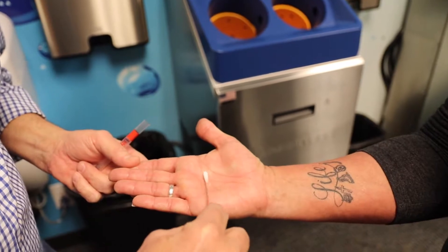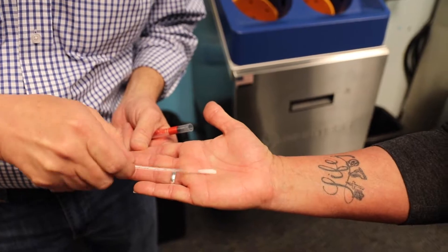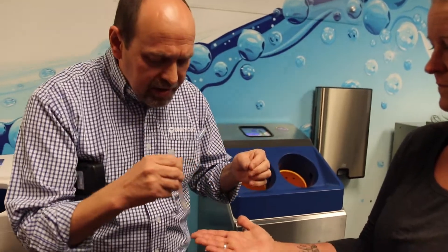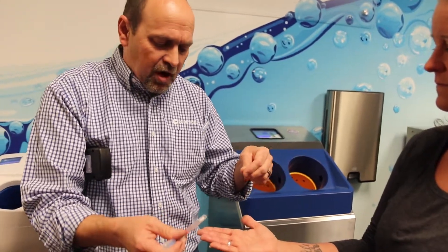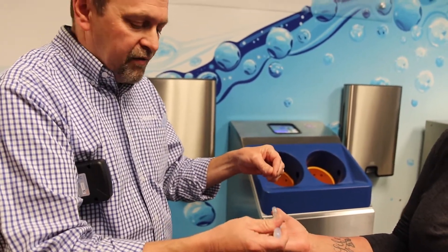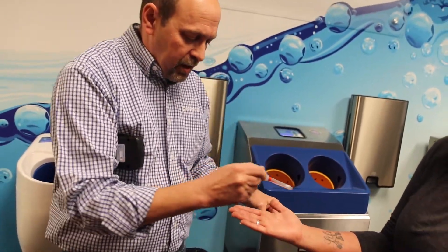I'm going to color that square in, two-by-two, and rotate it 90 degrees, turning the swab the whole time, then draw an X. The reason I use just a two-by-two square within the palm is for consistent methodology. I'm not swabbing the entire hand, because tracing the whole hand lifts off unevenly. I use the same consistency of pressure, coloring one way then the other, and always put an X in the middle.